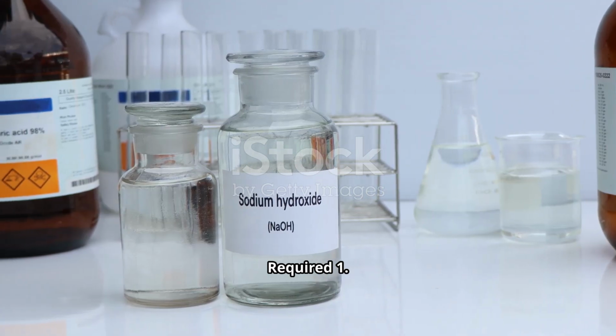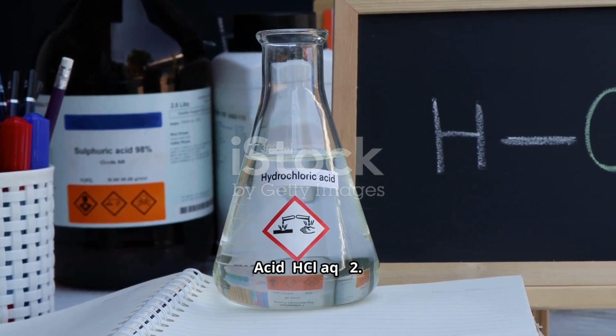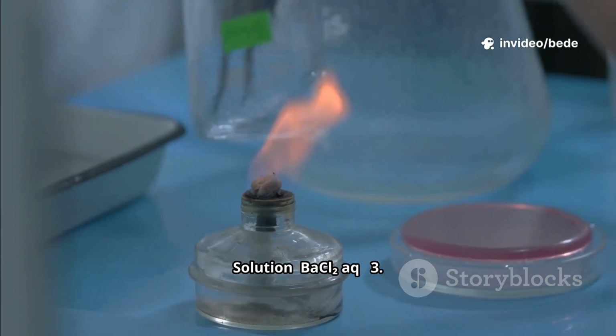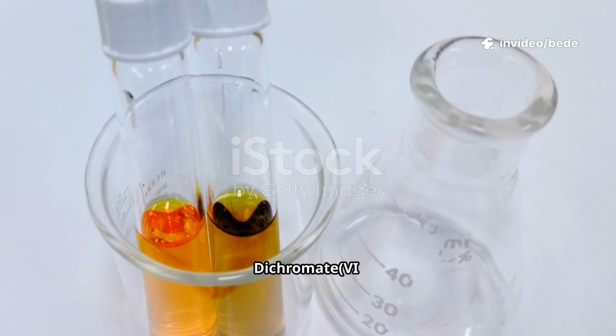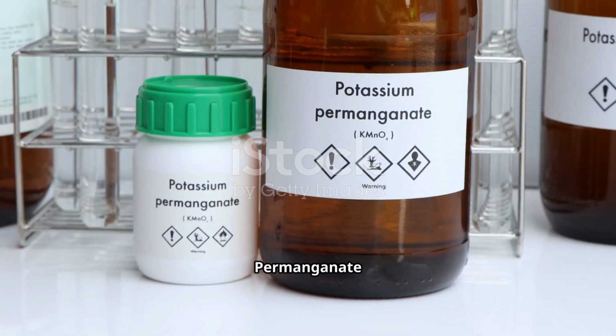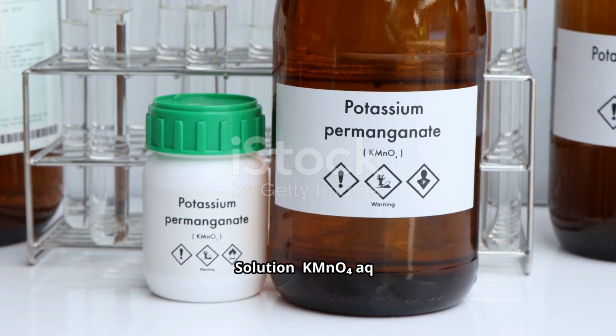Bench reagents required: 1. Dilute hydrochloric acid, HCl, aq. 2. Barium chloride solution, BaCl2, aq. 3. Acidified potassium dichromate solution, K2Cr2O7, aq. 4. Lime water, Ca(OH)2, aq. 5. Potassium permanganate solution, KMnO4, aq.